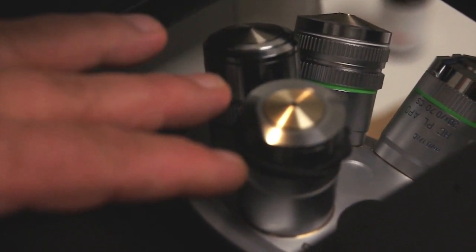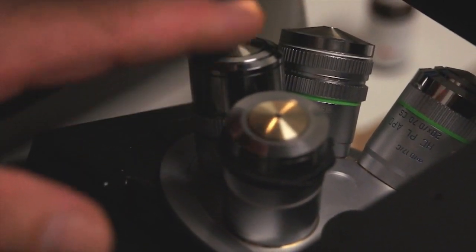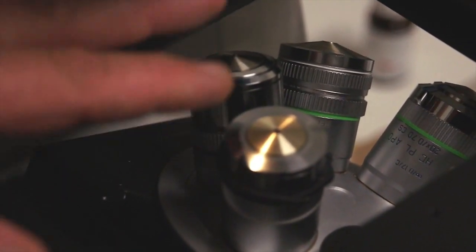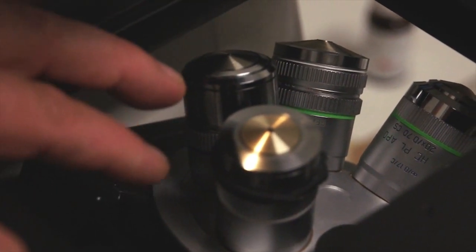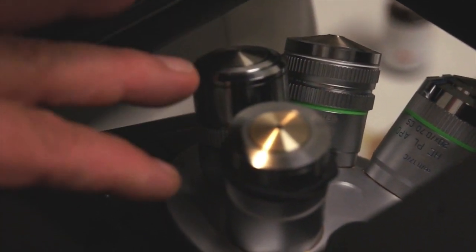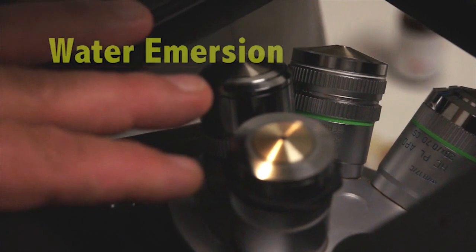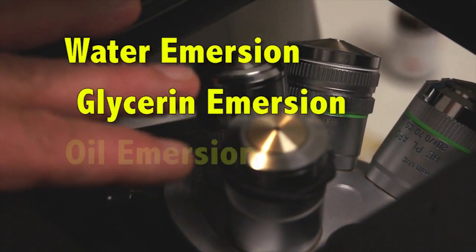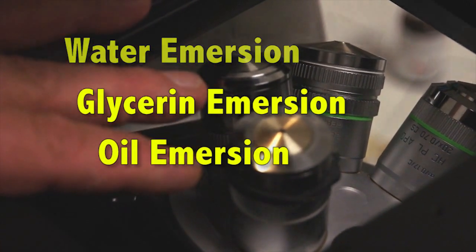Later on in this sequence we will discuss every objective on here, the magnification of it and the particular parameters of each of the objectives. Several of them are immersion objectives. They might be water immersion, glycerin immersion or oil immersion. And we will discuss all these at length.